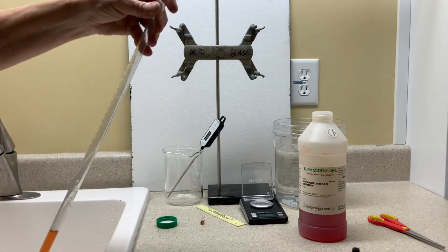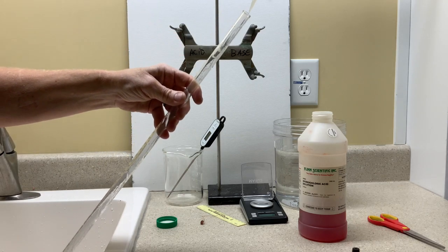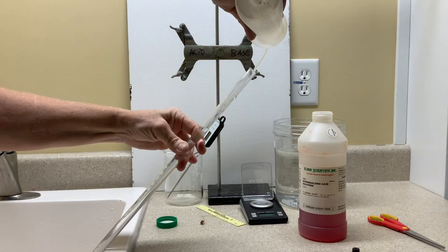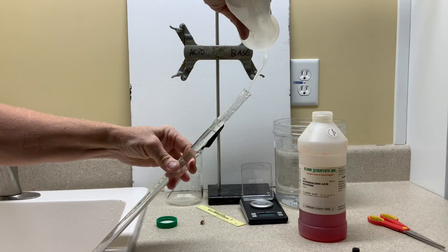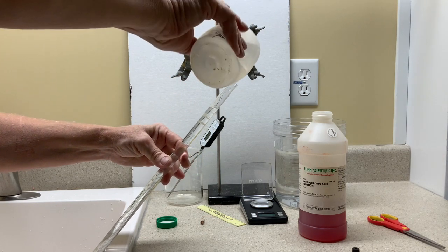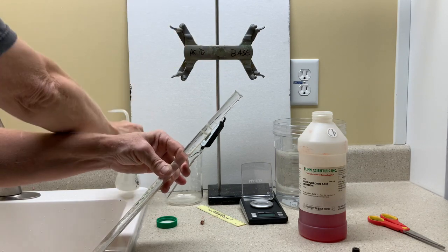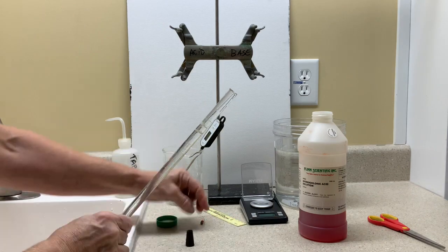Next I'll add water to fill it all the way up to the top so that we'll be able to measure the volume of gas that forms. When the water is in the tube we can of course see the bubbles forming and know when the eudometer contains a particular amount of gas.